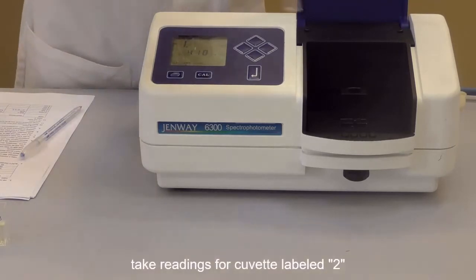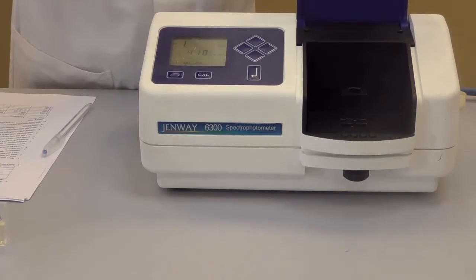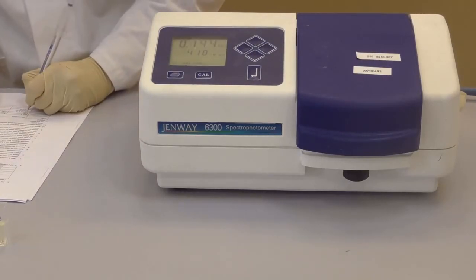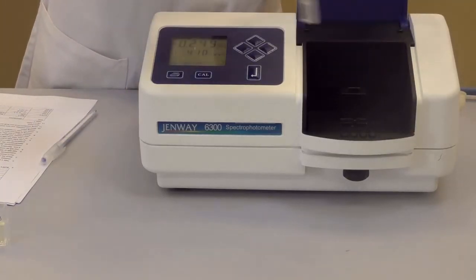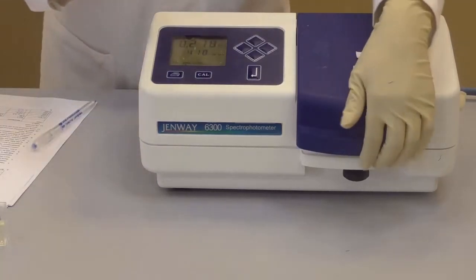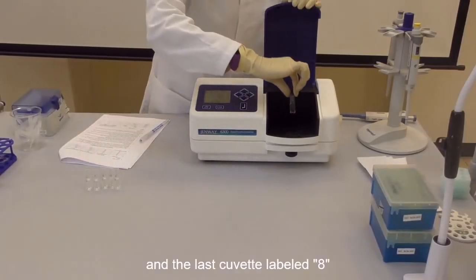Repeat the reading for cuvettes labeled 2, 4, 6, and the last cuvette labeled 8.